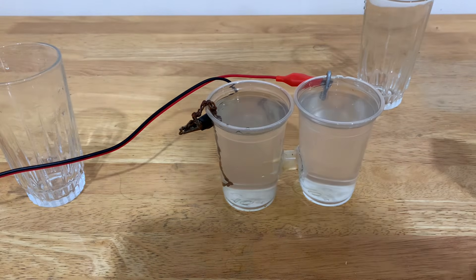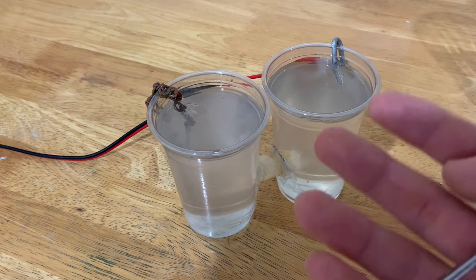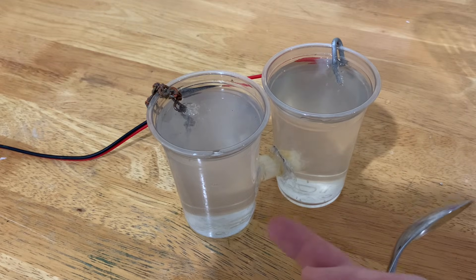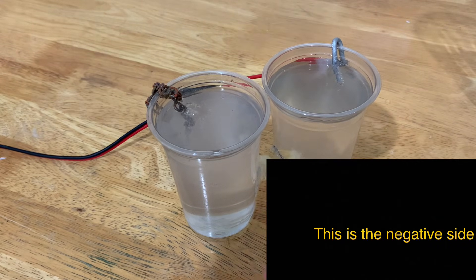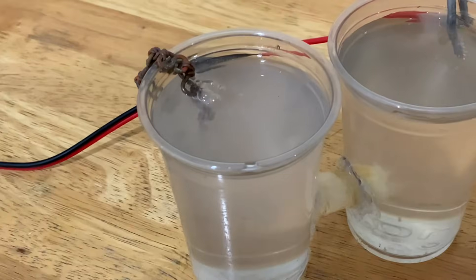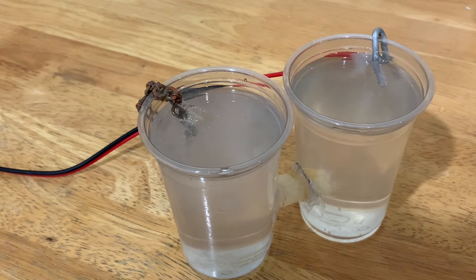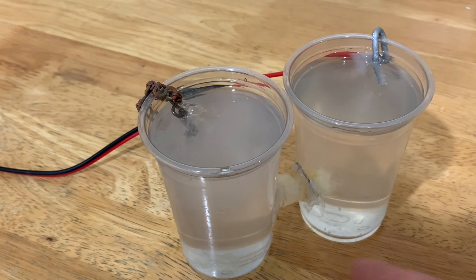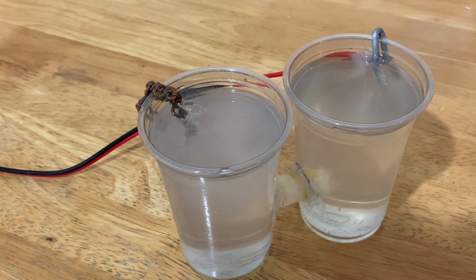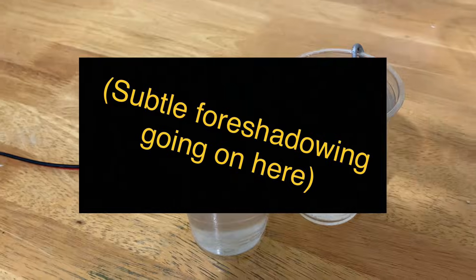Over time, this will make sodium hydroxide. I put a little more cotton inside of this tube and now I'm going to wait for about a day — the more you wait, the merrier. The more sodium hydroxide concentration comes on this side, and you can see that the process is really happening from the hydrogen bubbles rising up on the negative side. If you have hydrogen bubbles on the negative side, it's working. The voltage doesn't really matter for this thing — just make sure that the current isn't too high so that it overheats inside of this tube and melts, and then the whole thing spills out.